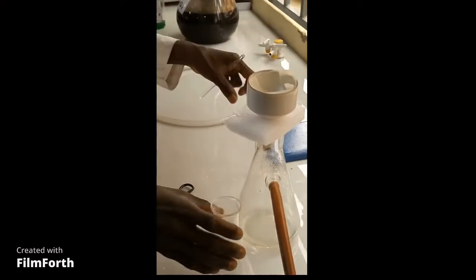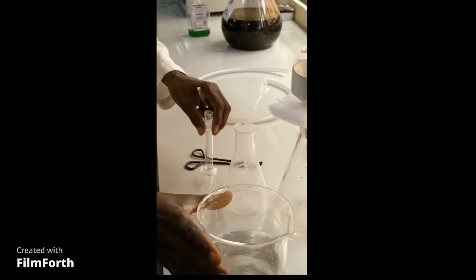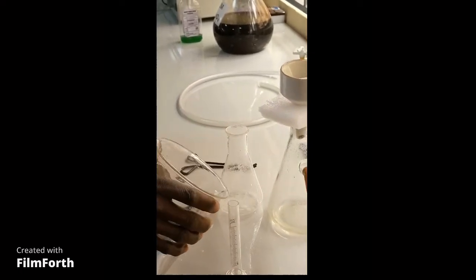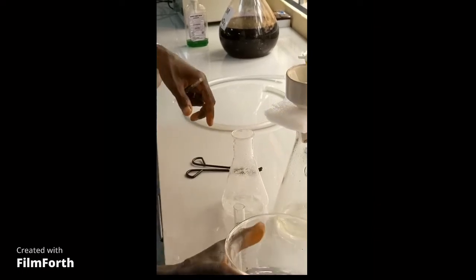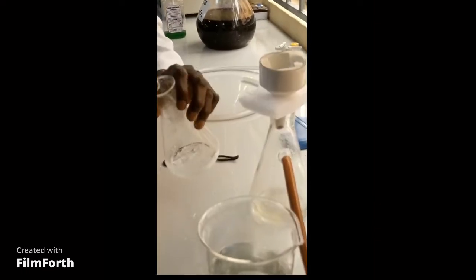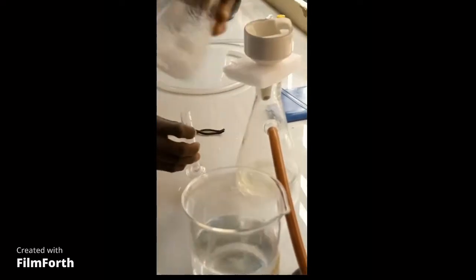Rinse the product in the conical flask with cold water — 10 ml of cold water. Rinse it with cold water.